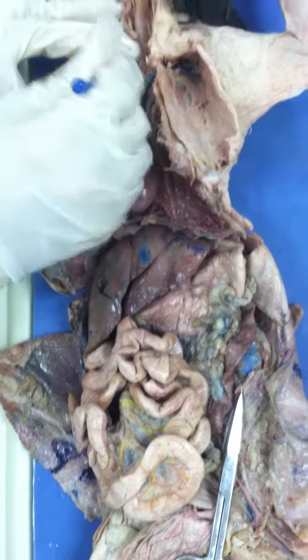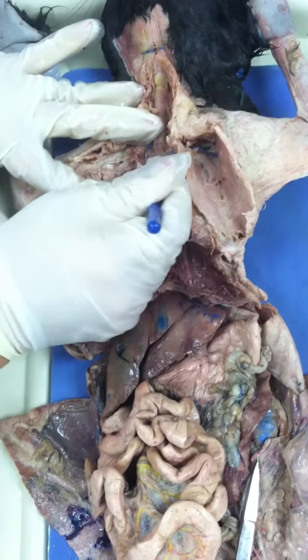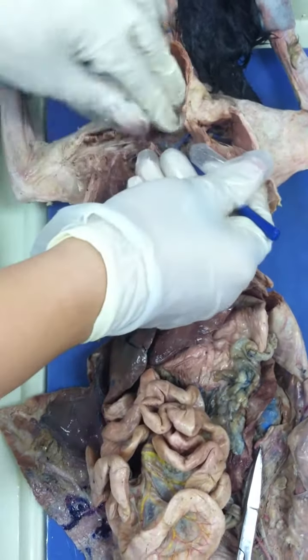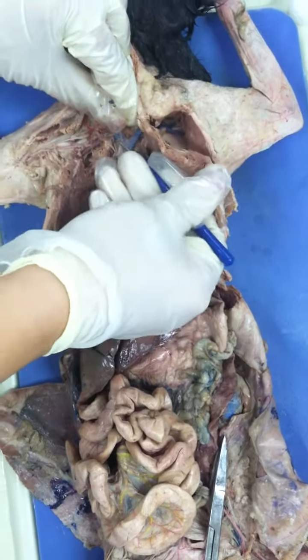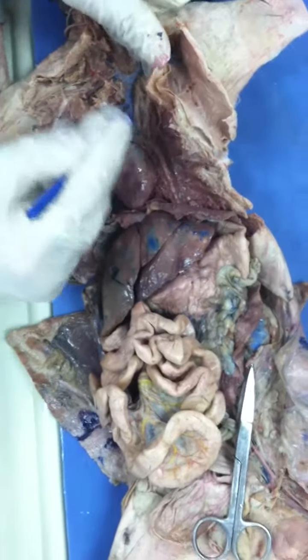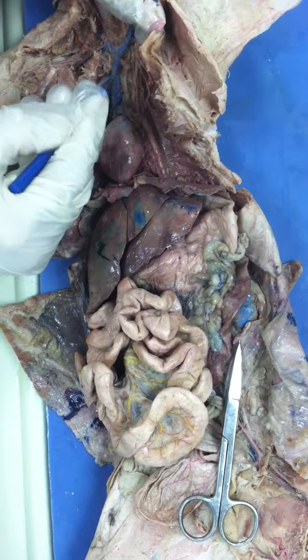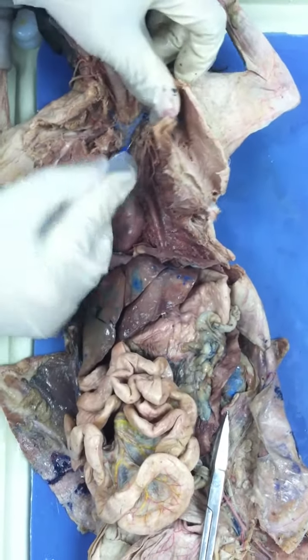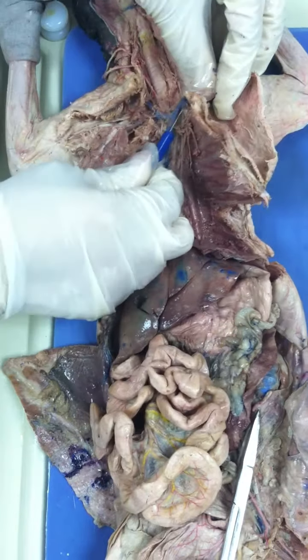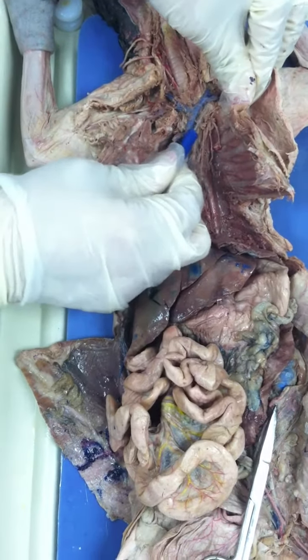Like in this occasion, you notice that it's going to branch out from this brachiocephalic. You see it here? Yeah. This is the vertebral, the right vertebral. And then the left should be, oh, you guys cut it? Oh, here you go. This is going to be your left one. You see it? Okay. Just the left vertebral.